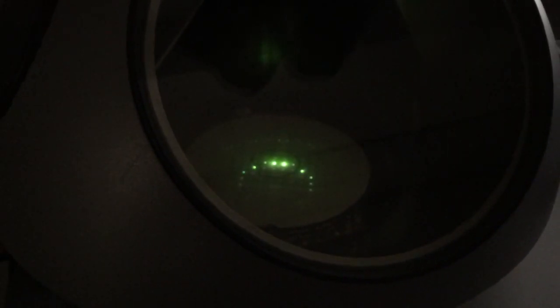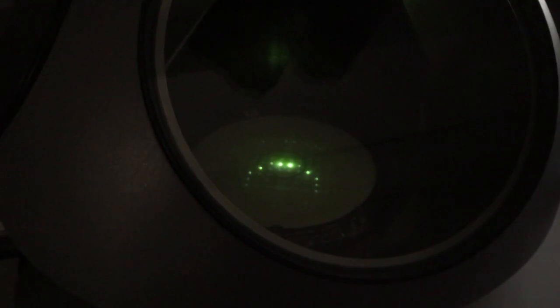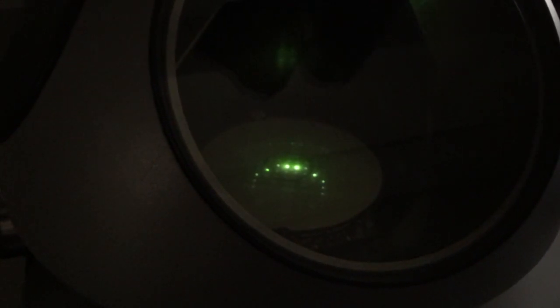Now if I want to set up what's known as a weak beam dark field image, I have to tilt the beam just like I did in centered dark field, but how I tilt the beam is different. You want to start from an S that's basically 0 or slightly positive. We do have an S of 0 right now. Left is the direct beam, right is the Bragg beam. Now I'm going to tilt the incident beam to move the direct spot to the spot that is opposite of the Bragg spot.